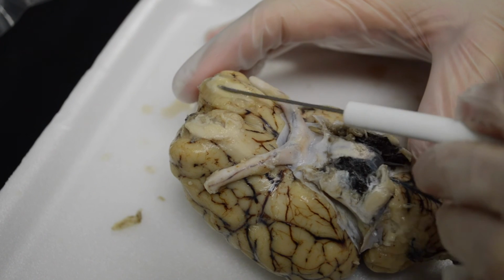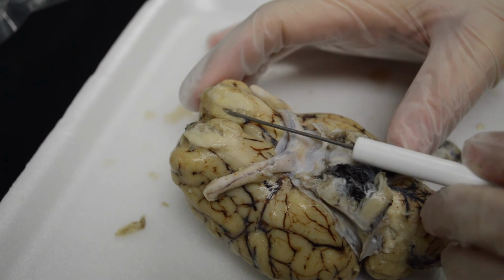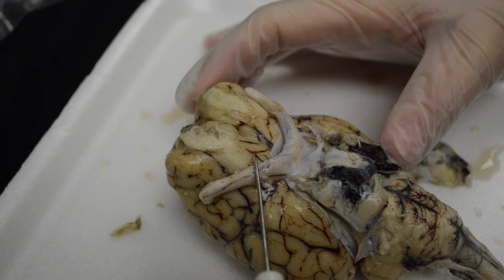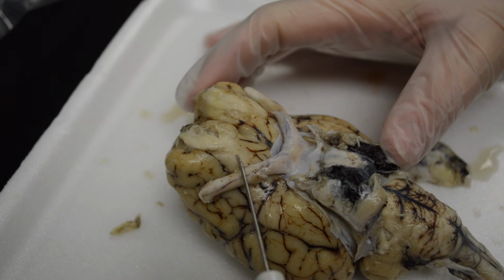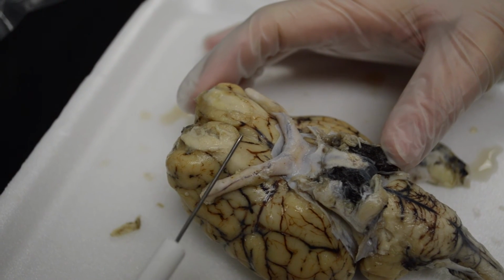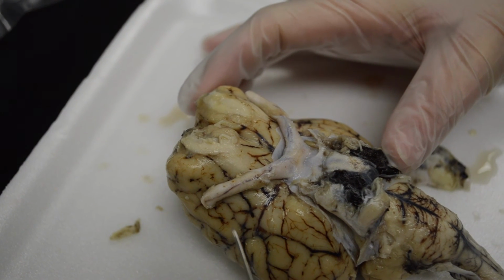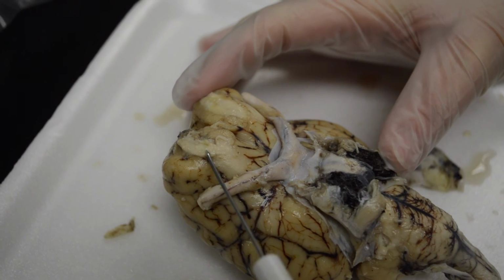These are the olfactory bulbs, and this is for the first cranial nerve, and they are for smell. An extension of the olfactory bulbs are the tracts. So these are the axons, right? The bundles of axons that will extend from the sensory portion of the olfactory bulb. Okay? That connects with the sensors in the top of the nose.